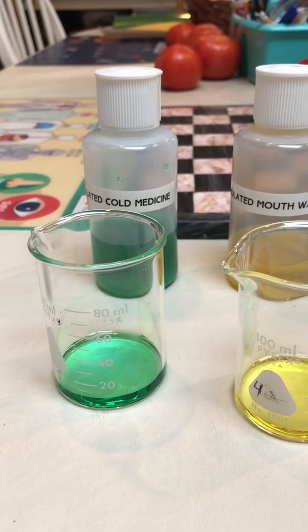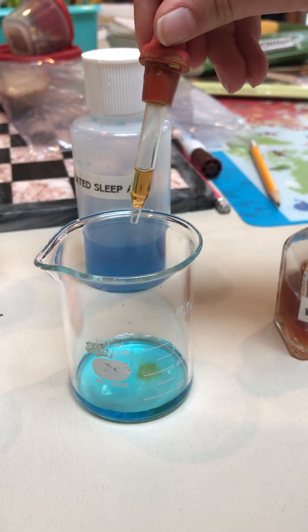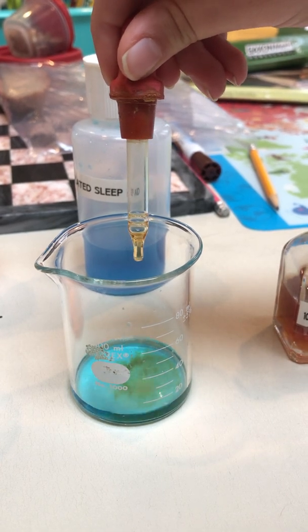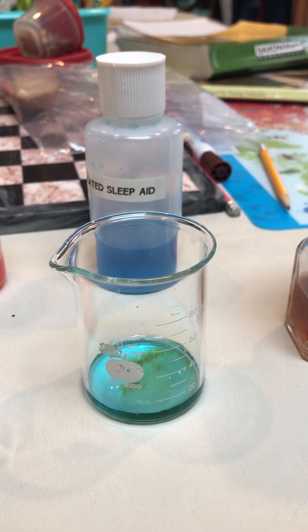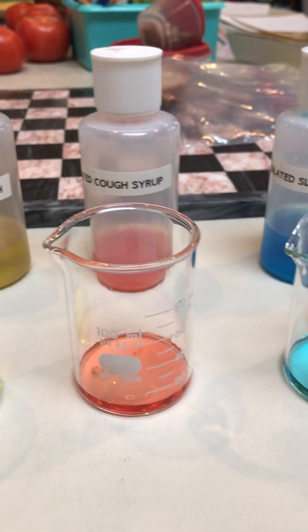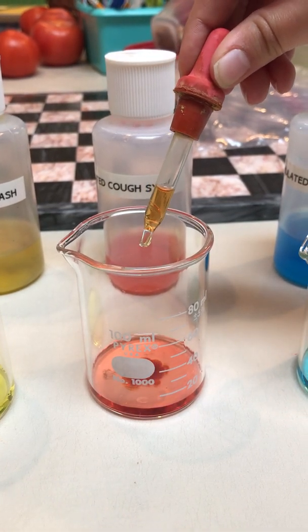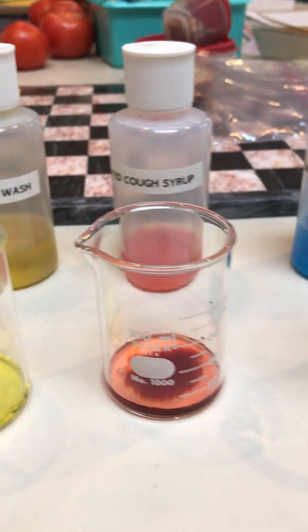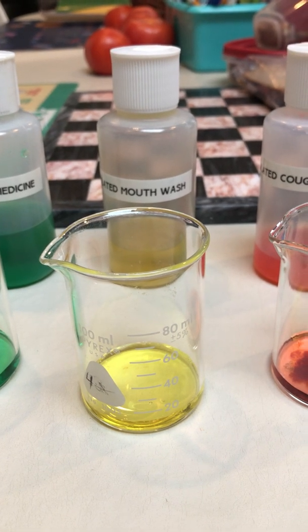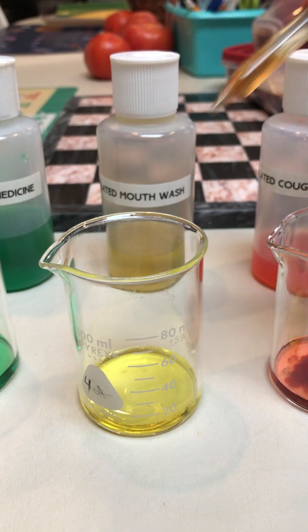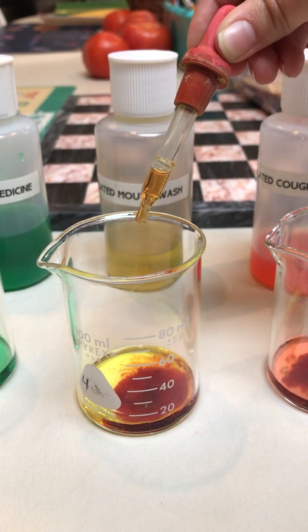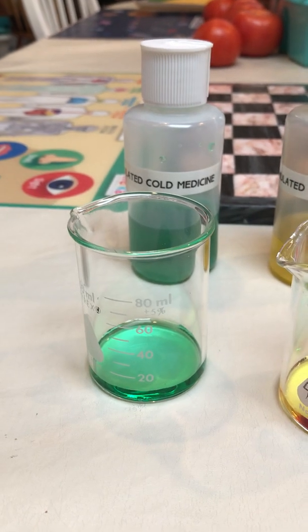All right, now Bridget is going to dispense five drops of 10% ferrous sulfate into each of the beakers. So go ahead, Bridget.